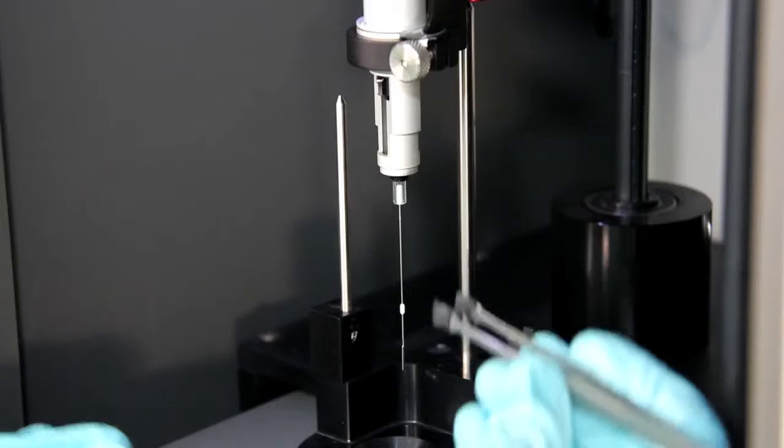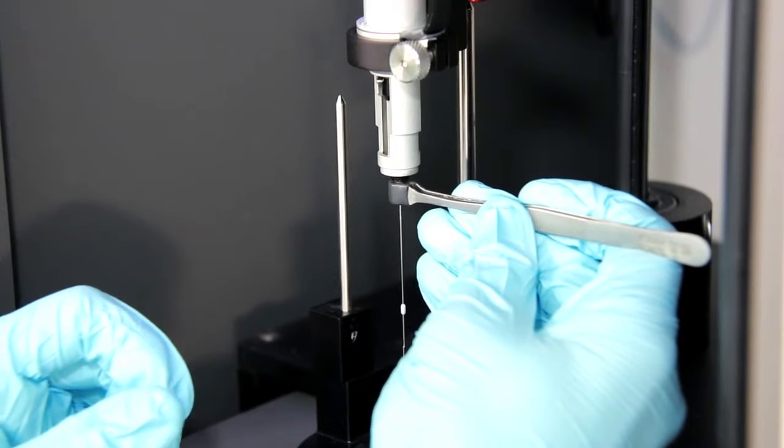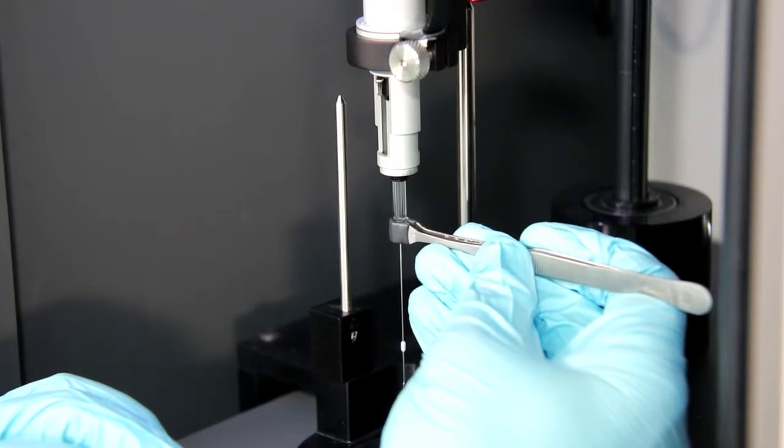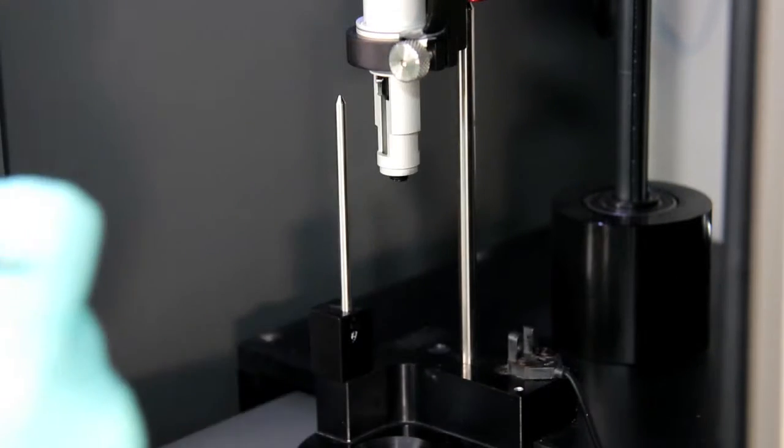You can see that more of the syringe glass is exposed, making it easier to remove the syringe with the soft grip tweezers. You may set the syringe aside.